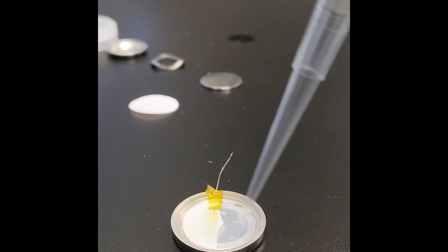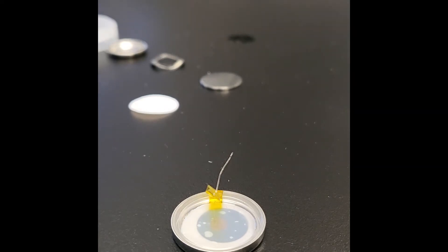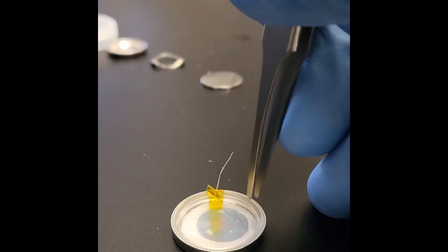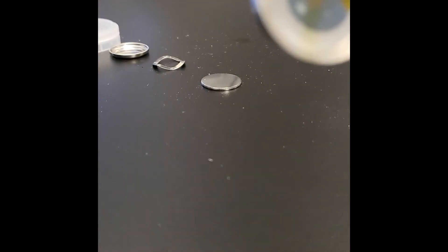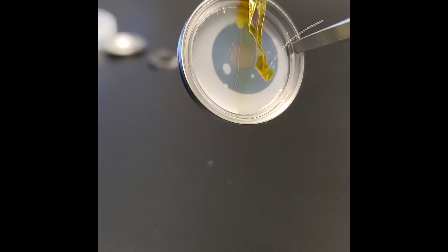Now is the last chance to add any extra electrolyte if you are trying to make a flooded cell. You can see how all the components are placed. Actually, there is one mistake here that we didn't notice when we were filming. Notice that the insulation is covering the edge of the electrode sheet. This misplacement should have been avoided by placing the positive electrode slightly lower than how it has been placed in this picture.